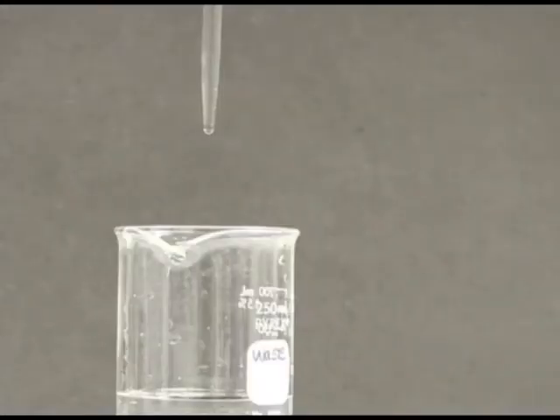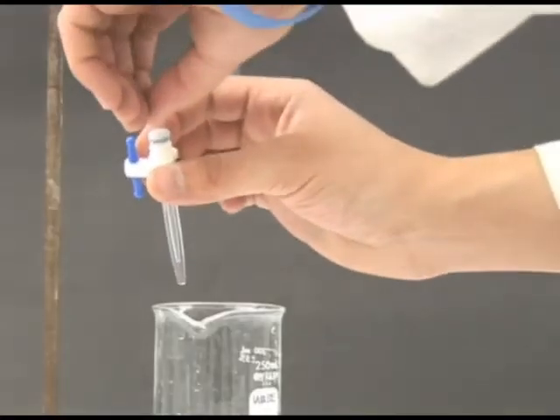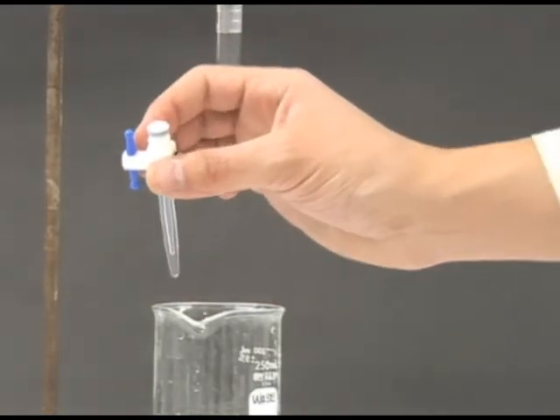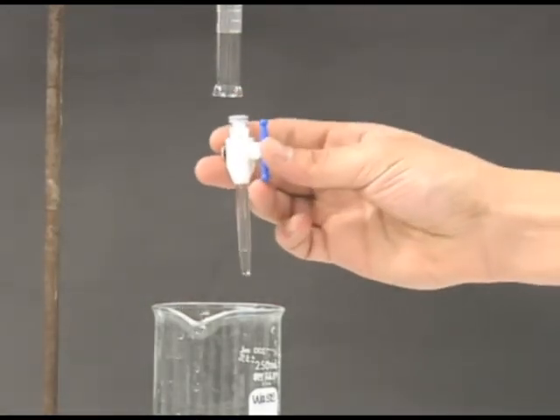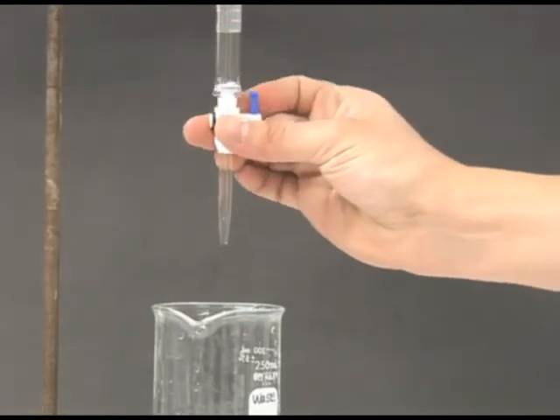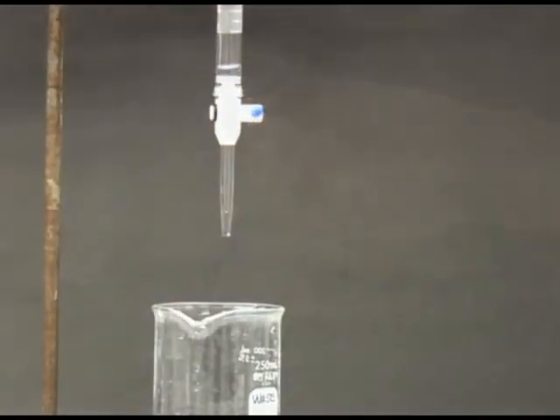If it does not, then remove the tip and clean it with a thin wire to remove any solids that may be clogging it. Replace the burett tip and add a few milliliters of distilled water to finish rinsing.